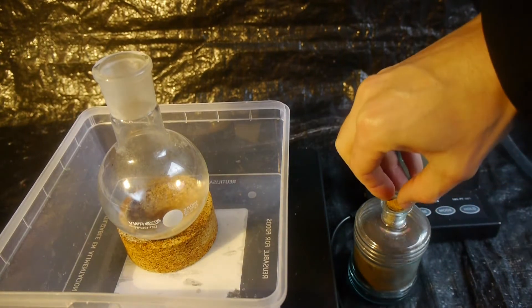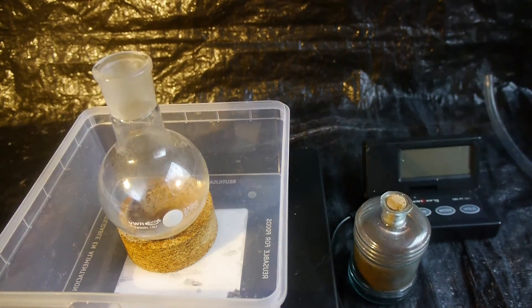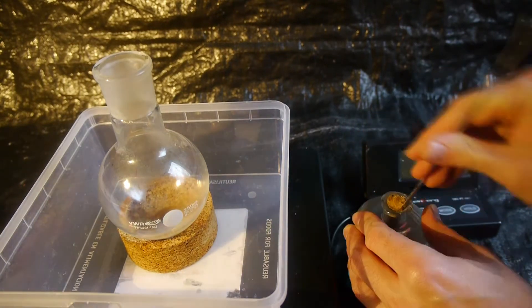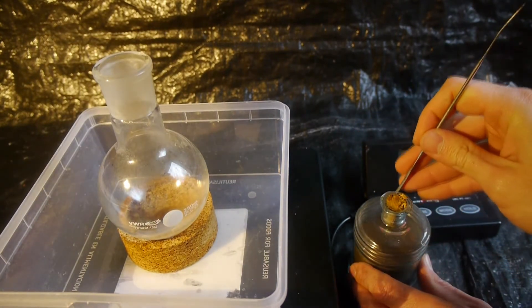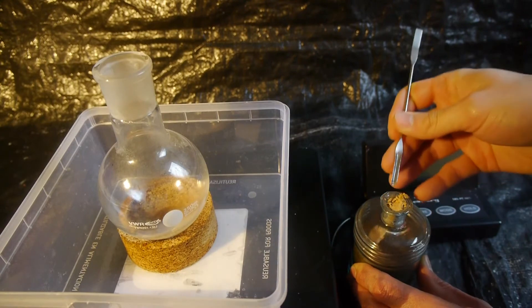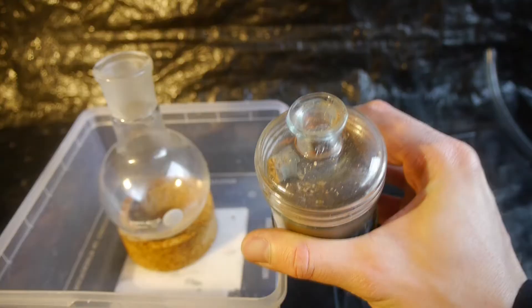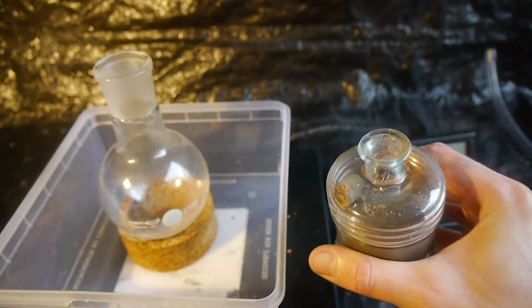Amazing, this is sealed with a wooden cork. It's probably the safest sealing method for mercury. Probably can't get this out in one piece. Oh, shoot. I wonder how old this is. Simply opening this was an adventure on its own.